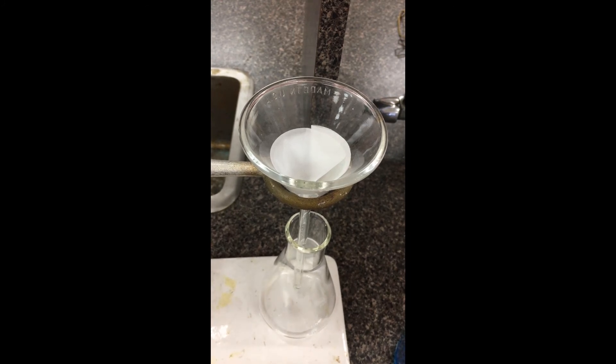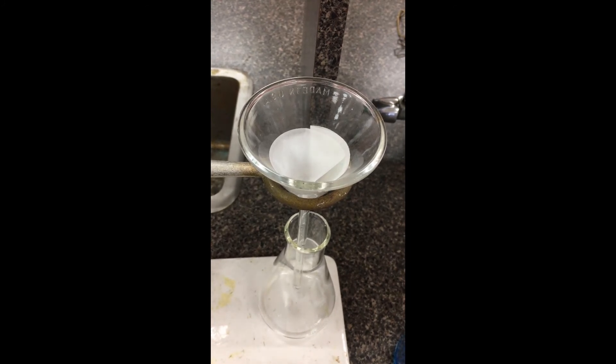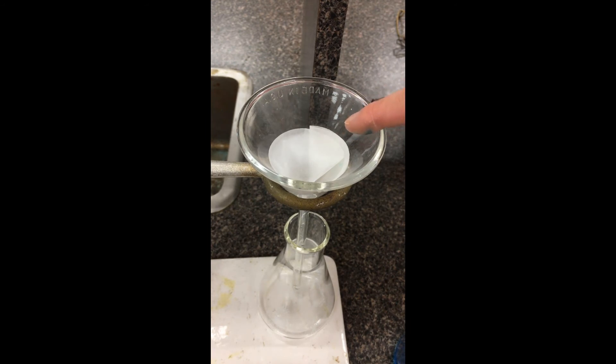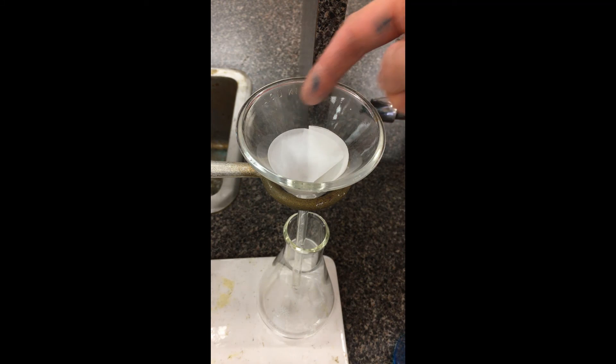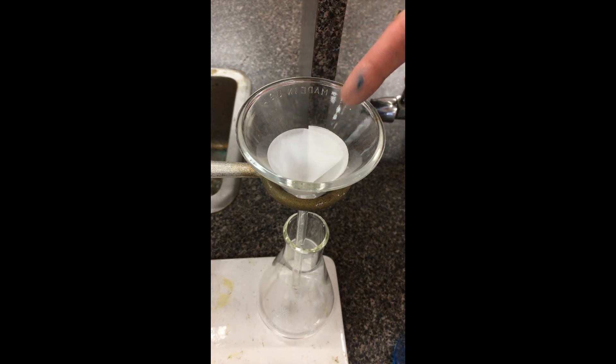And this is another shot of the filtration after it has been completed. So we have the residue that's left behind in the filter paper here. The filtrate has gone its way through. I'm still going to see a little bit of moisture left behind by the filter paper. Just leave it in the air to evaporate.